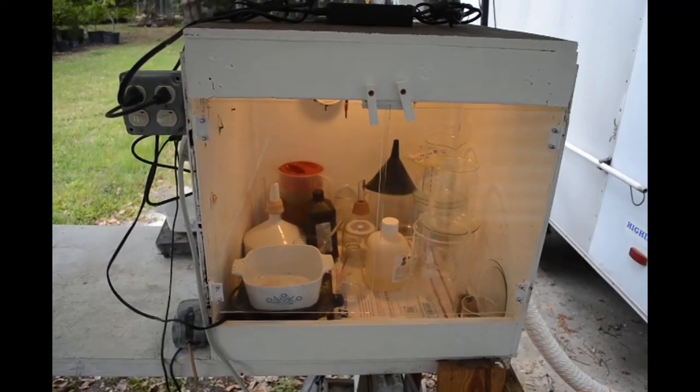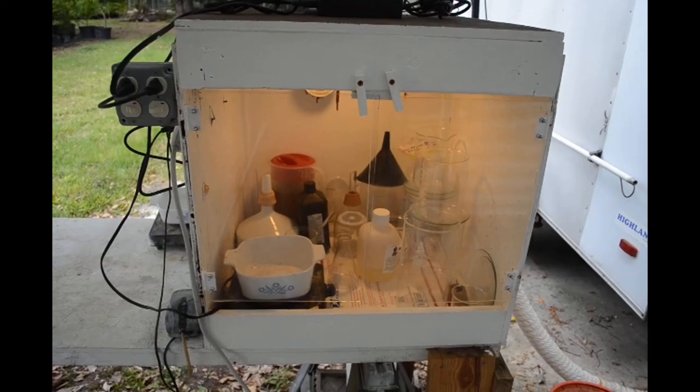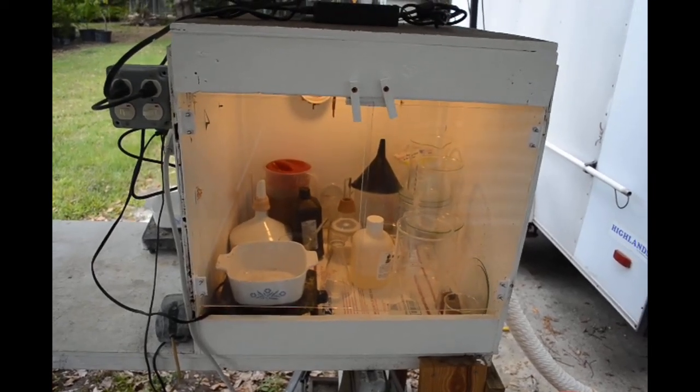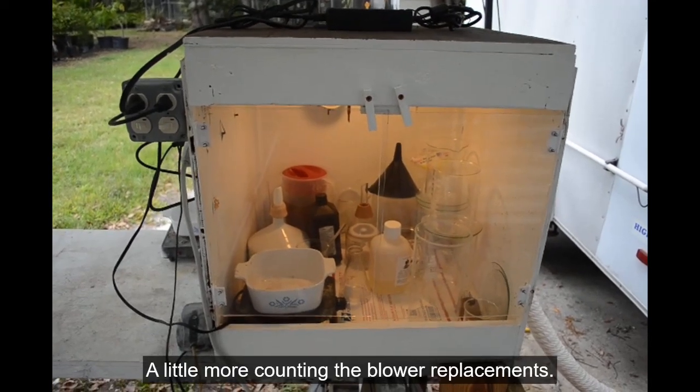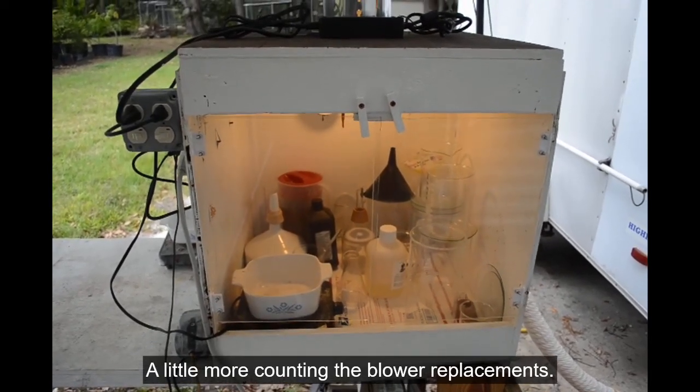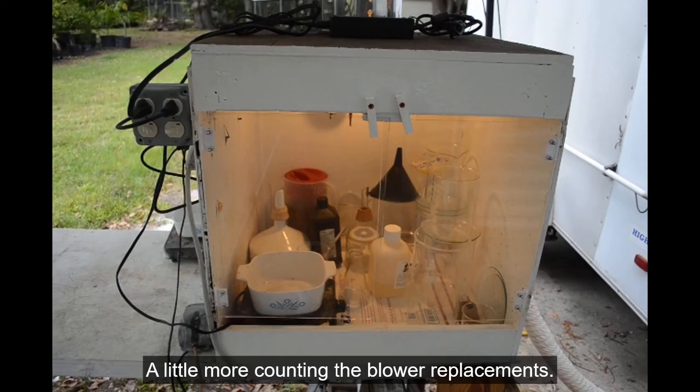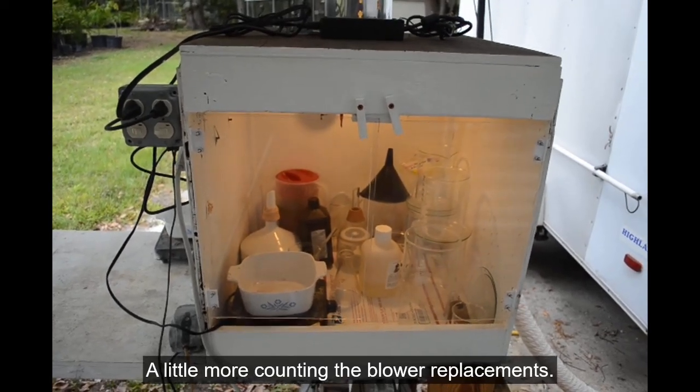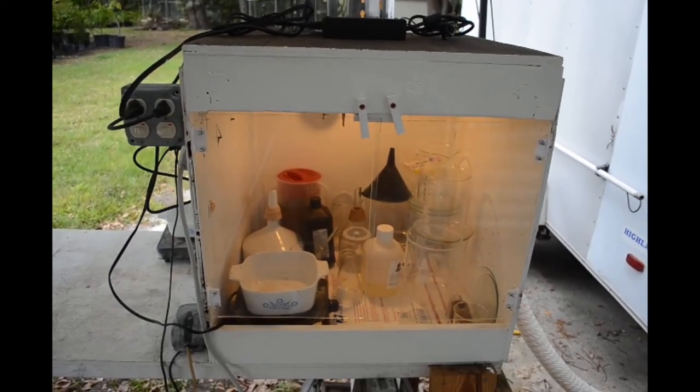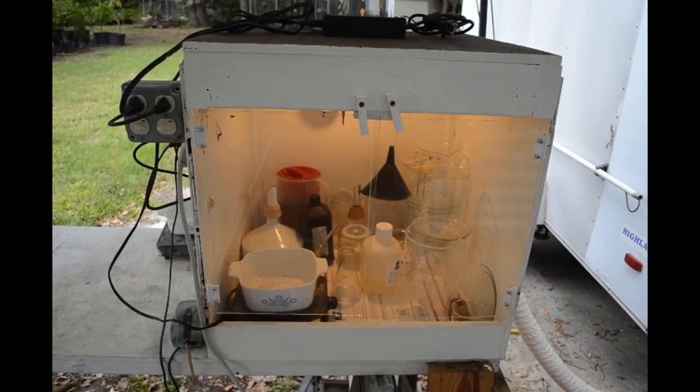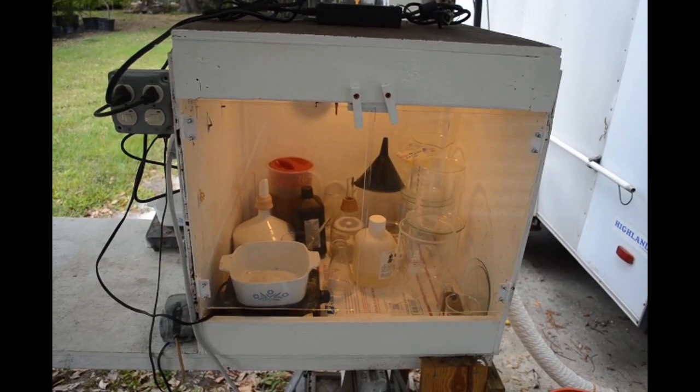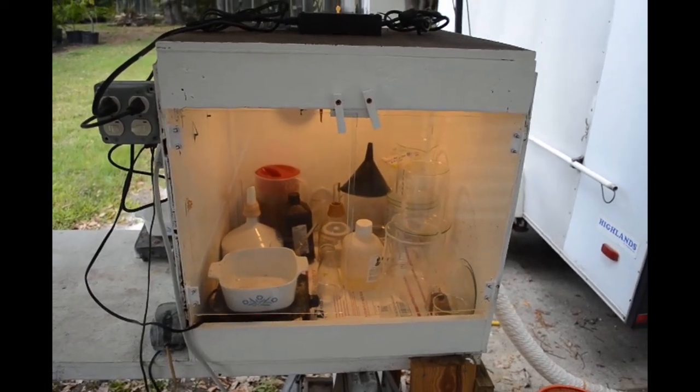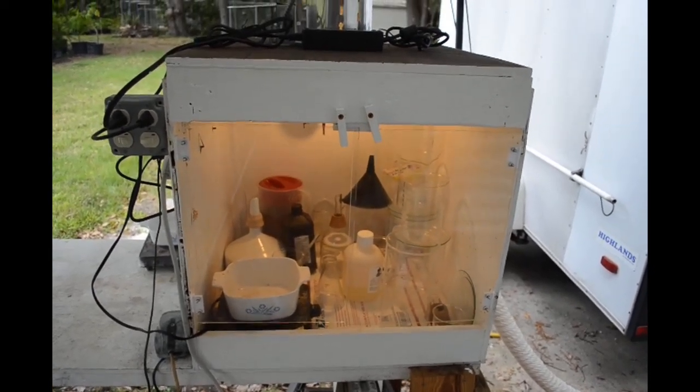Build yourself a fume hood. I don't even have probably a hundred dollars in this thing, maybe 75 or 80. Build yourself a fume hood, protect your lungs, protect the coatings on your glasses, protect your eyes, protect your skin. These chemicals will damage all of those things.